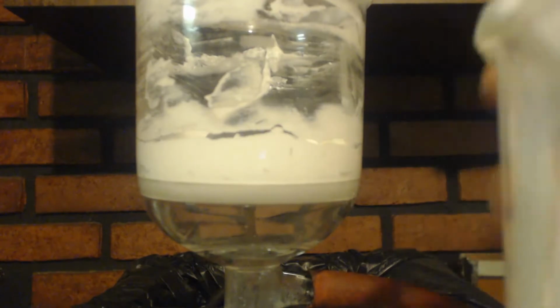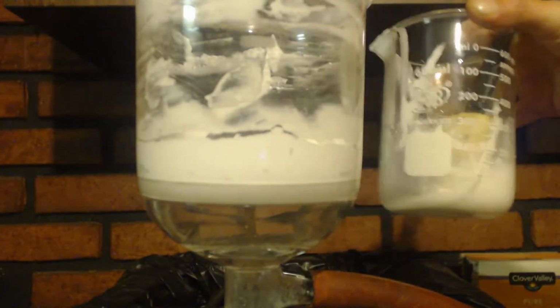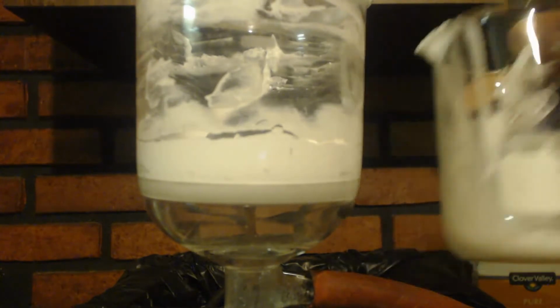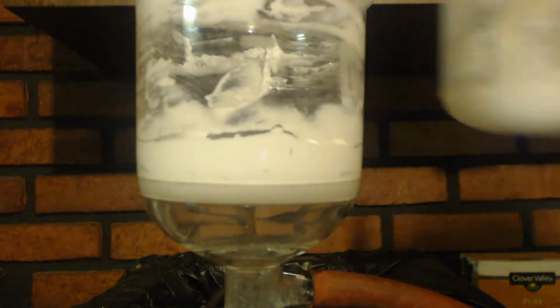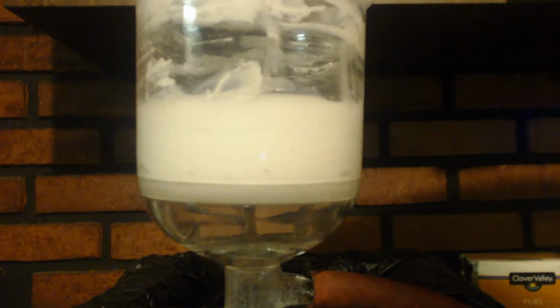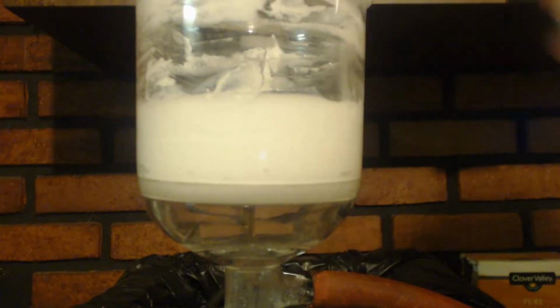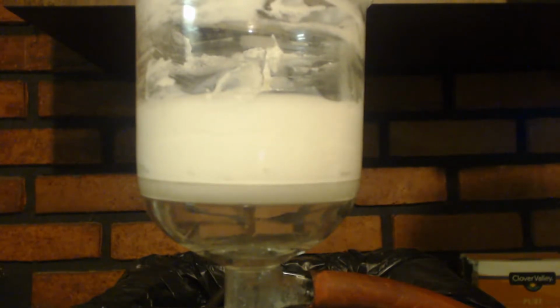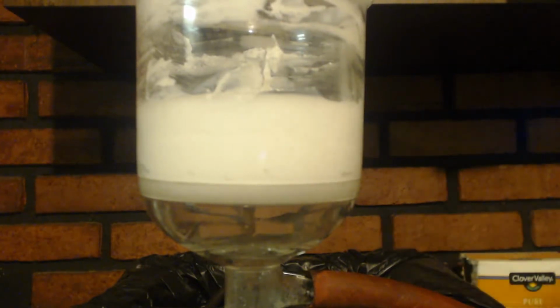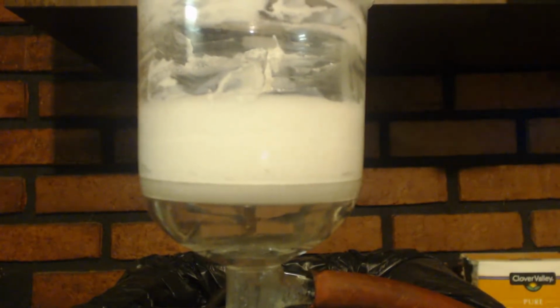Alright, so I put some more water in the beaker I was using and stir it around to clean it up, get some of that out of there. And I'm going to wash this. I'm going to pour it right in here. The solubility between warm and cold for the calcium sulfate is not very different, so it doesn't matter. But if you use warm, the other stuff will be more soluble, the stuff you want to get out of there, you know what I'm saying? So it's better just to use really warm water.